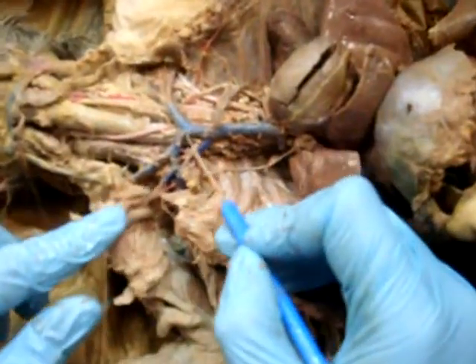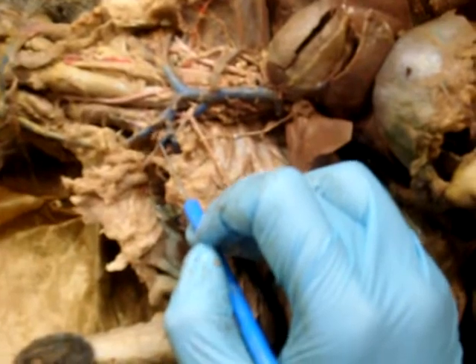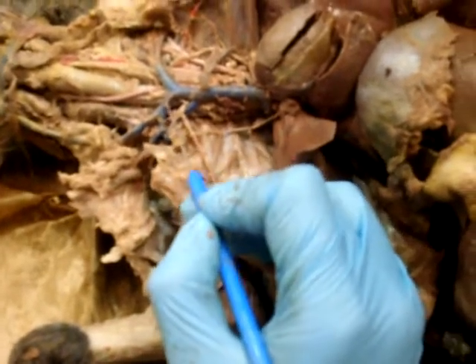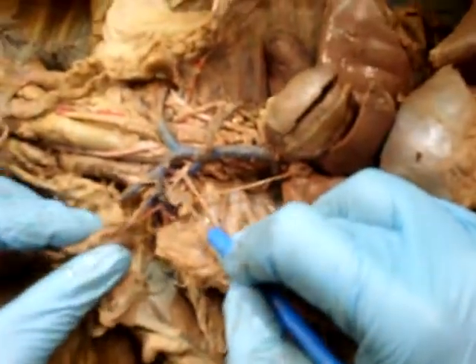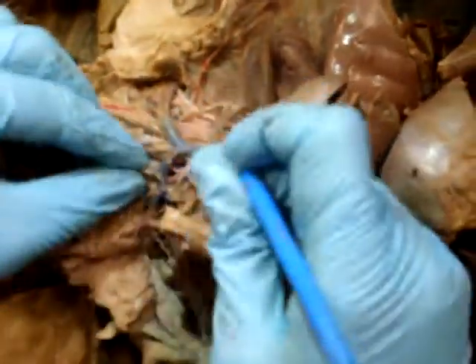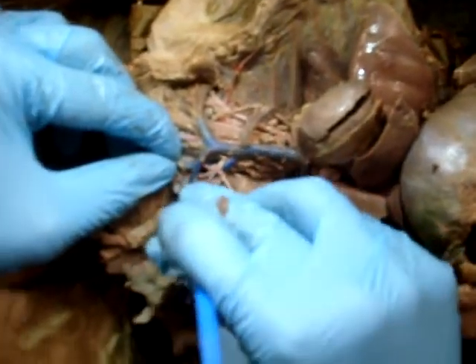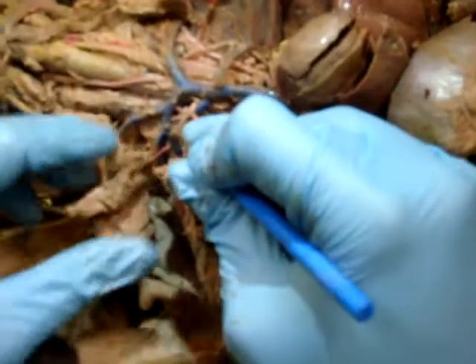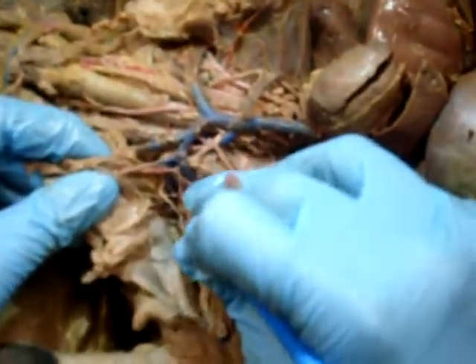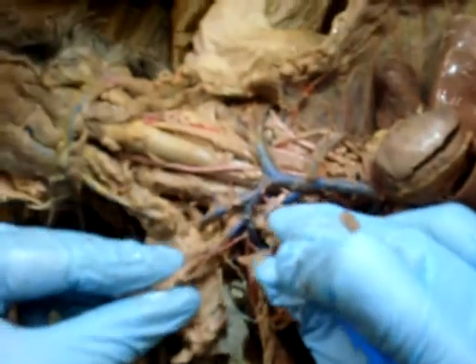Okay, so then from the Y, you become the subclavian, right? So then it's number 7. After you go from here, then you become the subclavian, right here, actually. Sorry, you pointed properly. The Y is brachiocephalic, then you become the subclavian. Right there. See? Subclavian right here.